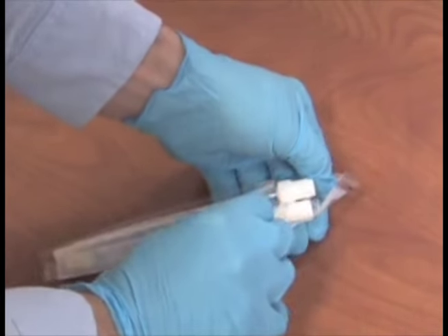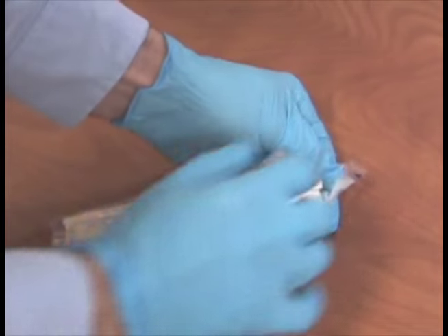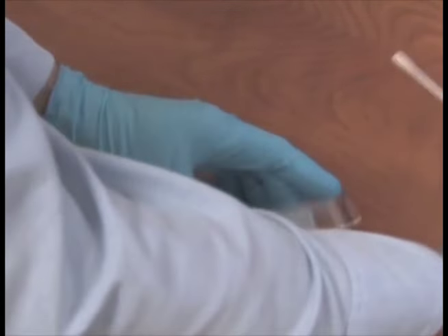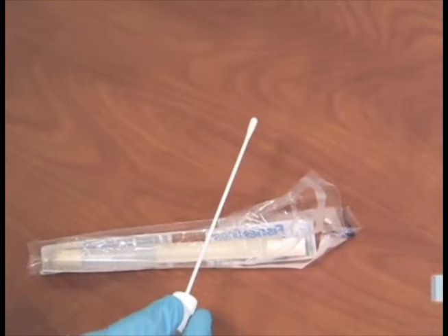One, pull apart the plastic wrapping of the swab until it is halfway open. Two, grasp the swab by the plastic handle at the top and remove from the wrapping.